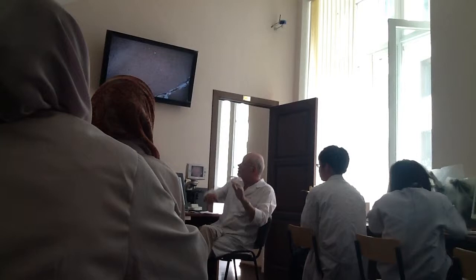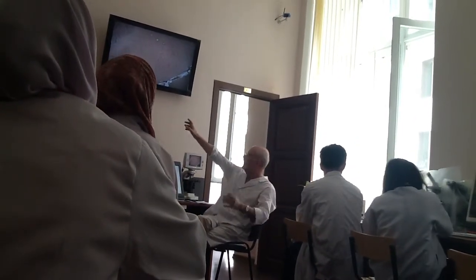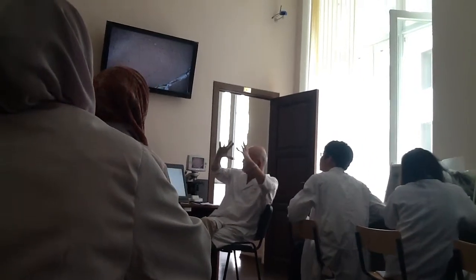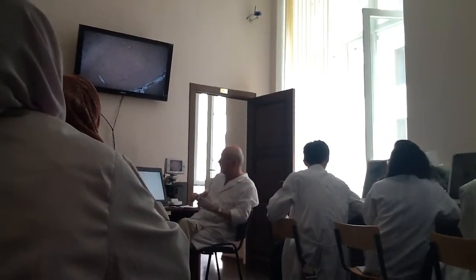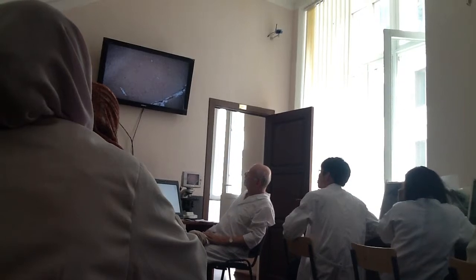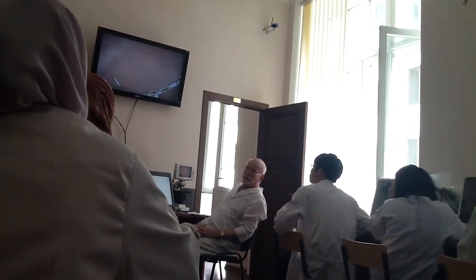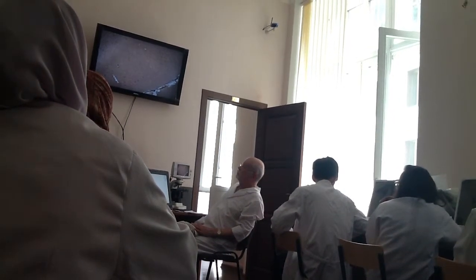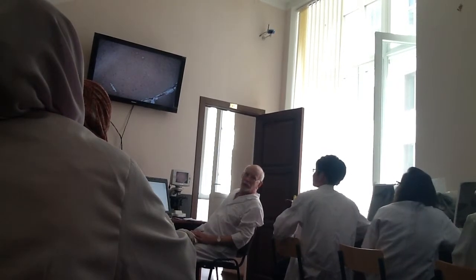Clear? So you found the first, superficial, easy. Then you found the fifth, easy because the neurons are ganglionic, large. Then you know that this less colored part of the slide, devoid of cell bodies, is white matter. So between the ganglionic neurons and white matter, what layer of cortex?